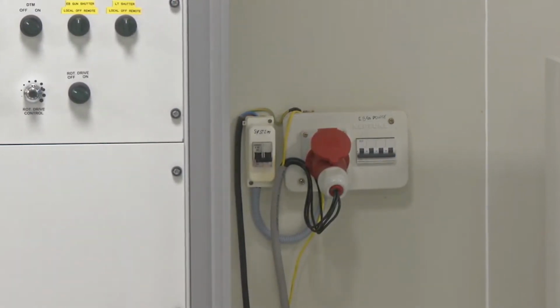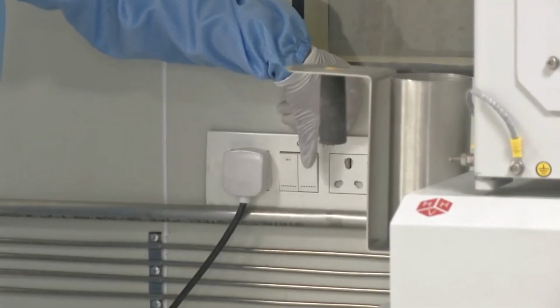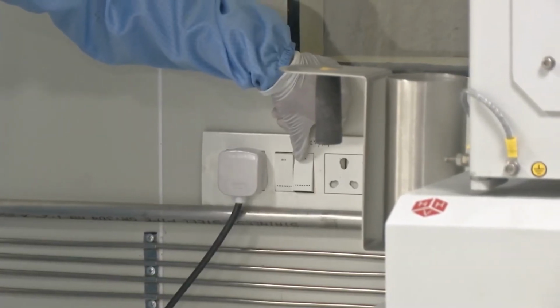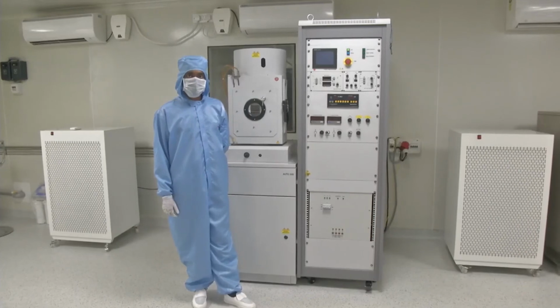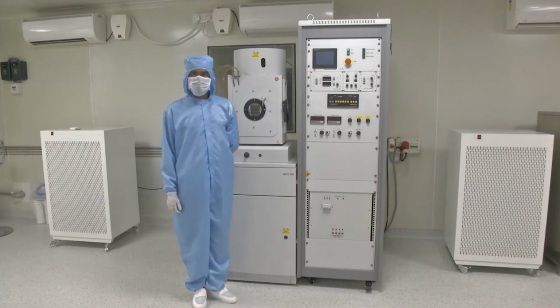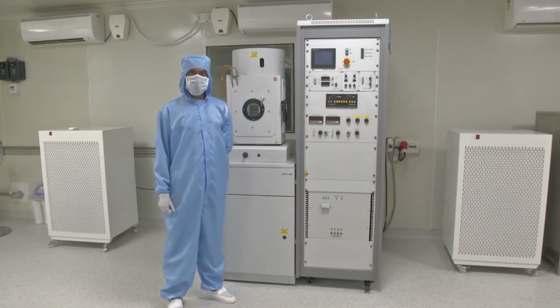The final thing is to turn off the chiller. The switch over there is for the chiller unit. So once the system is turned off, then we can turn off the chiller. This completes the deposition process and the system switching off process. So now, as we have turned off the mains as well as the chiller, it completes the system turning off and the deposition process in the complete sense. Thank you.